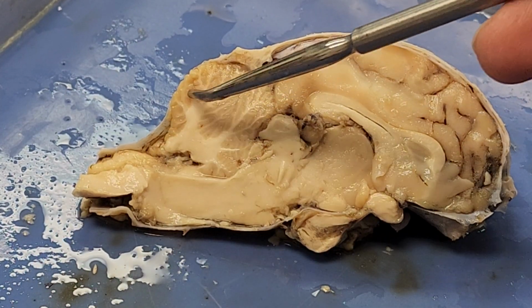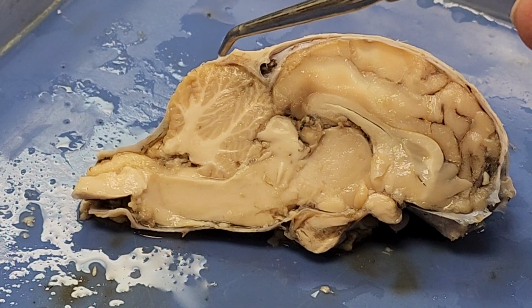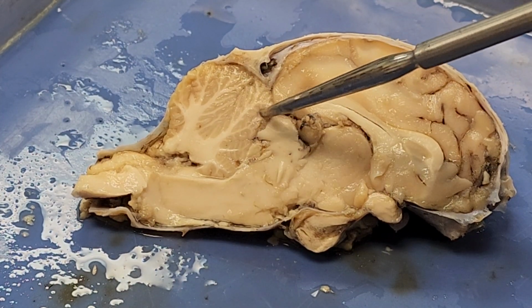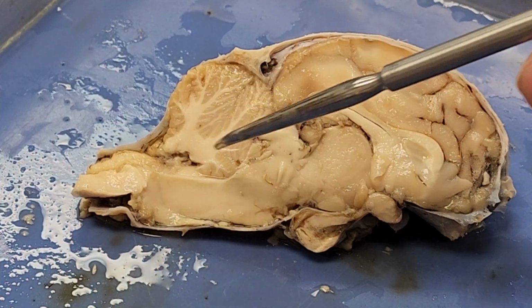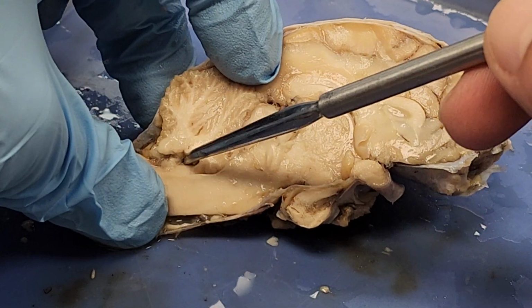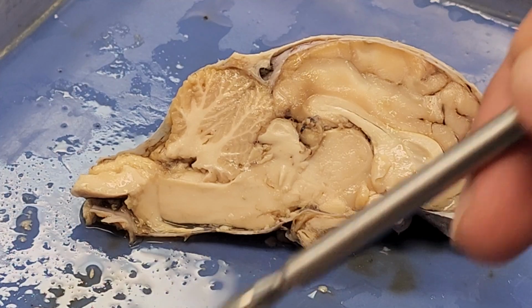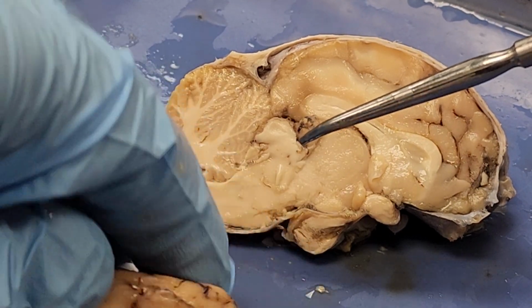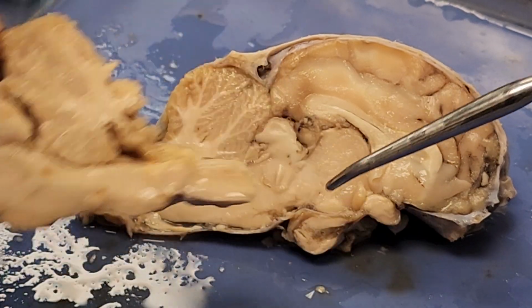Now, when I'm looking at my cerebellum in the back, cerebrum, cerebellum, don't confuse those. First thing that pops out is this white matter. Remember, we call that the arbor vitae. You can kind of see how it takes on that white tree appearance. And then along the bottom, there should be a little lip here for my fourth ventricle. Somewhere in here. I'm not really seeing it too well on this one. Let me check some of these other ones. We can see it a little bit better. Fourth ventricle. That's a pretty good fourth ventricle right in through there.